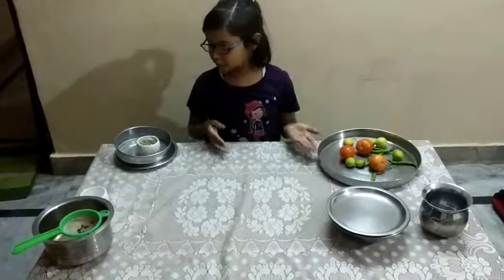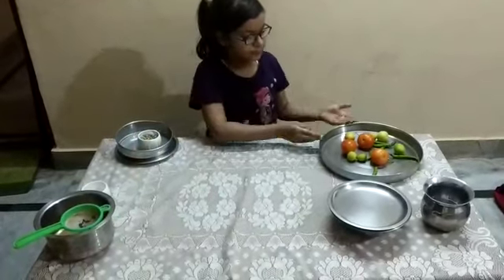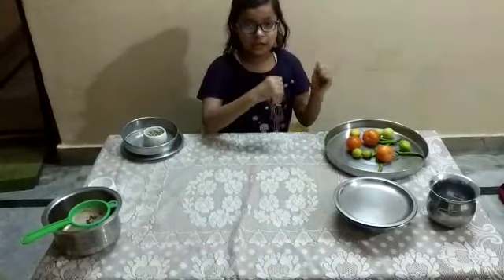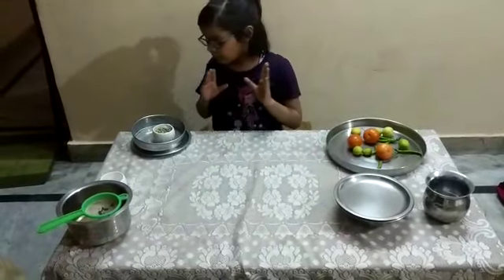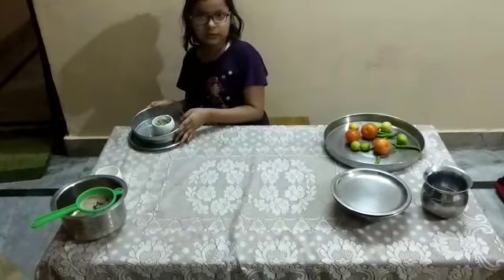We are going to do the process of sieving, filtration, handpicking, sedimentation, and decantation. So first we are going to do the process of sieving.